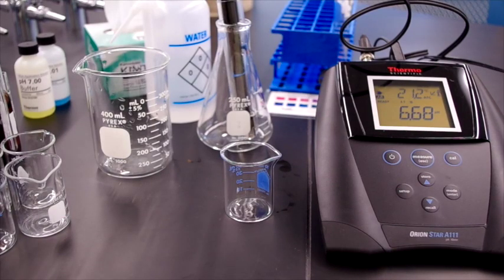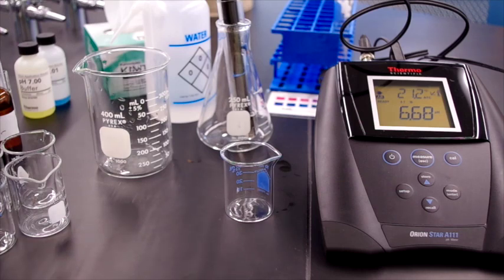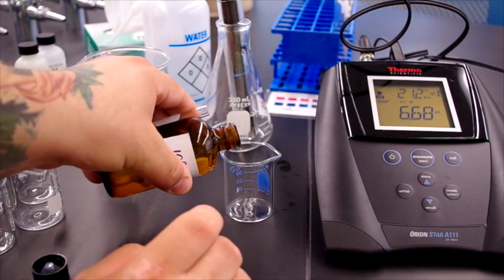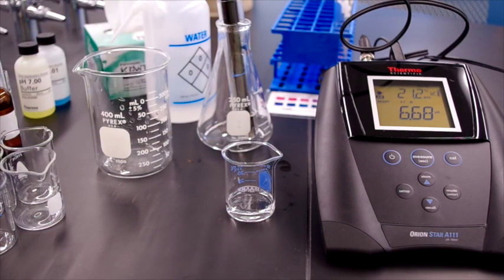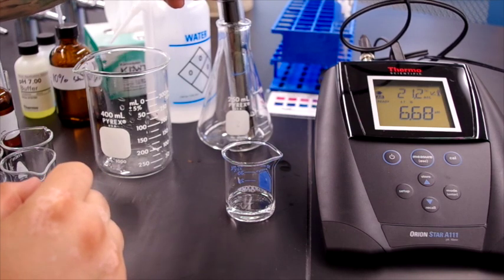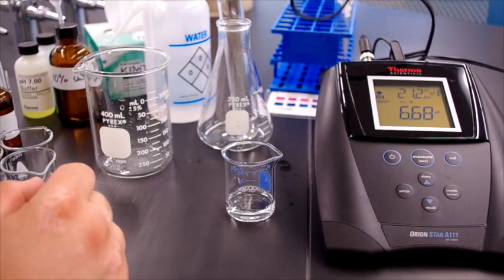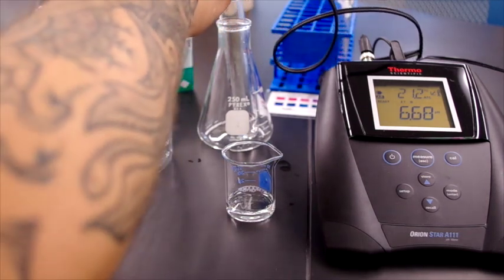Okay, so for the next part of part B, we're going to measure the pH of the same solutions using a pH meter. We're going to use a small beaker for each one of them, and place a small amount of this liquid into the beaker, starting with shampoo. We put in just enough to immerse our electrode, and then the important step before every pH measurement. It's right now in water, and it's reading a 6.68 pH, which is roughly as expected. We always rinse our electrode with distilled water before we take a measurement.